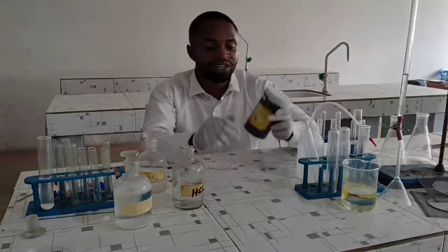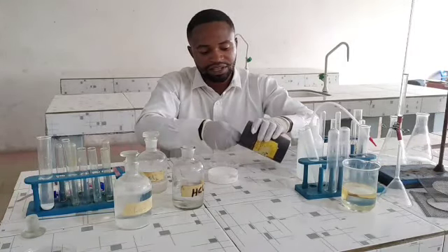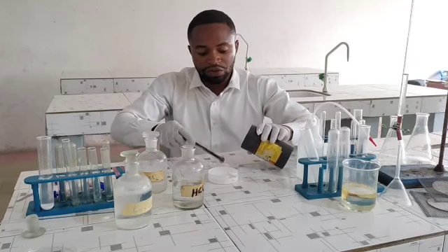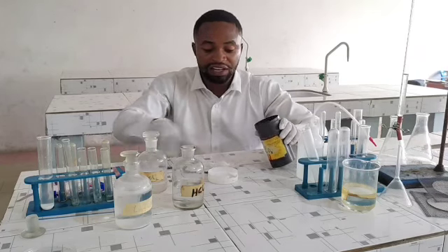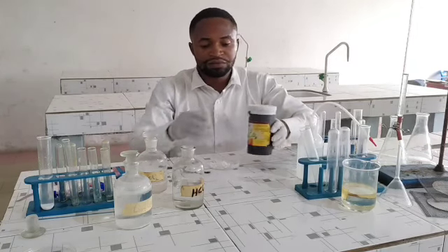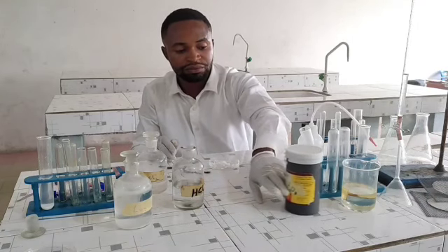Now, let's get started. The very first thing is that I'm going to get my sample. I'm going to use a spatula to get my sample out, like you can see here. At the end of the video, I'm going to construct the questions for you that you are likely going to see in the exam next week. Please pay attention. I've gotten my sample out of the reagent bottle.